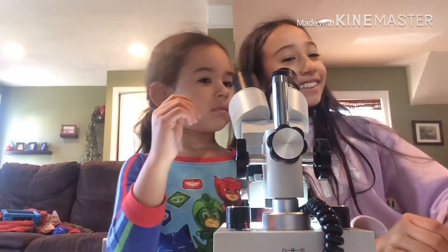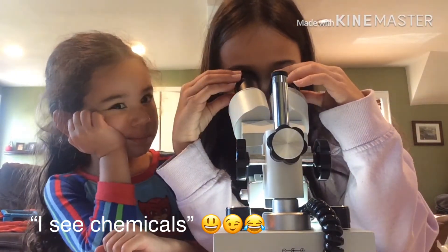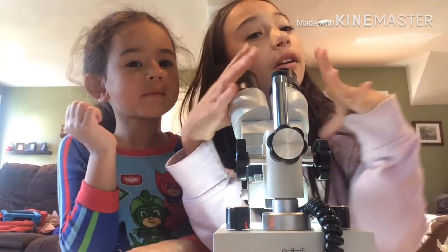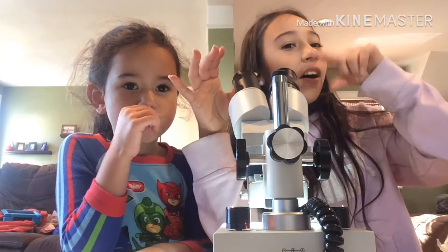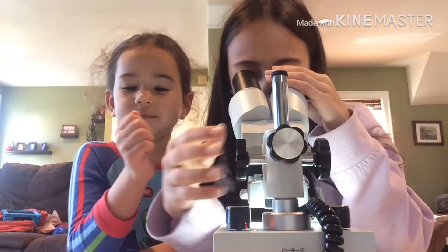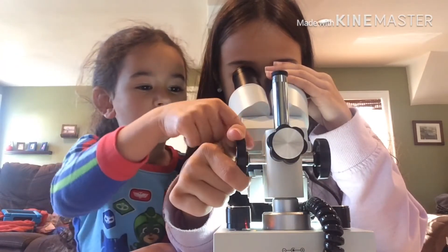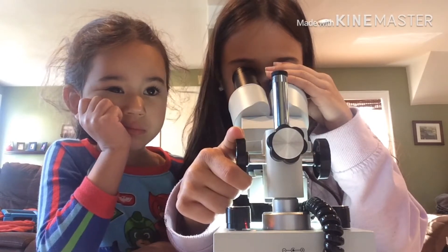What do you see? Describe it. I see a bunch of yellow stuff and I see like pollen! What does it look like? It kind of looks like little dots on the flower. Is it focused? You can move it up and down to focus it more — you see different things as you go up and down. It's very yellow.